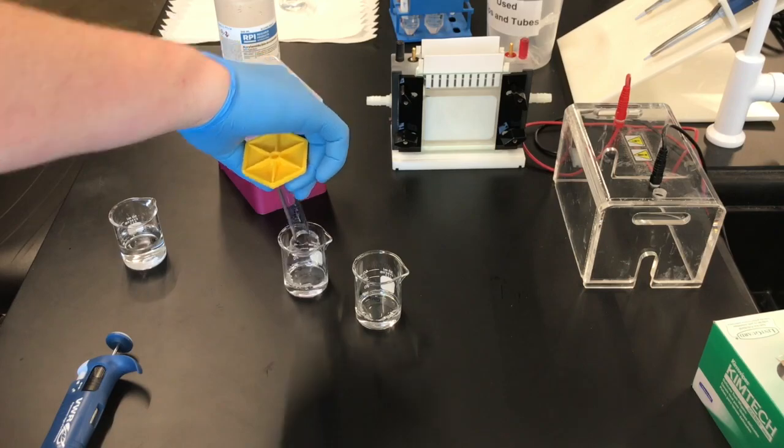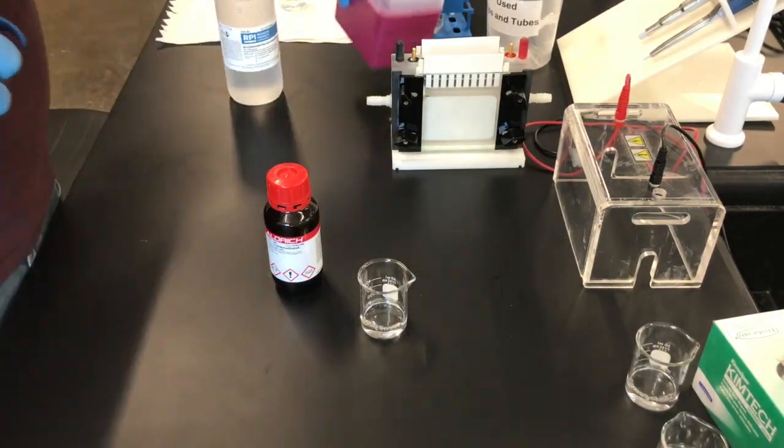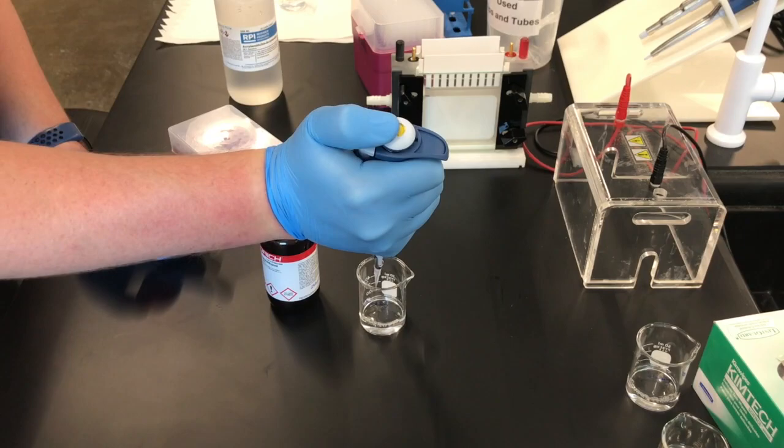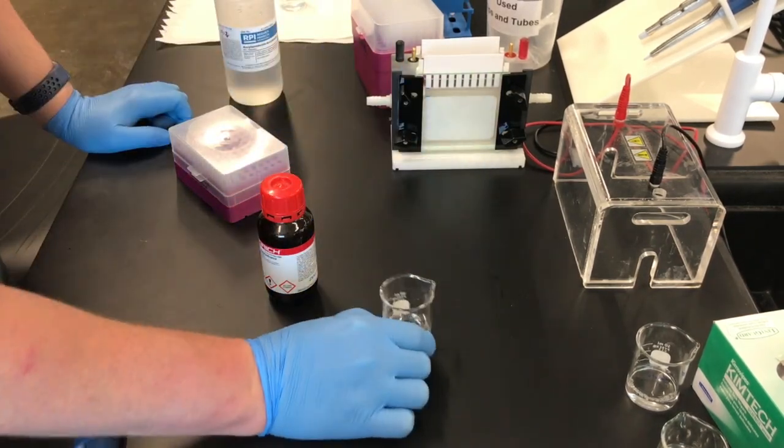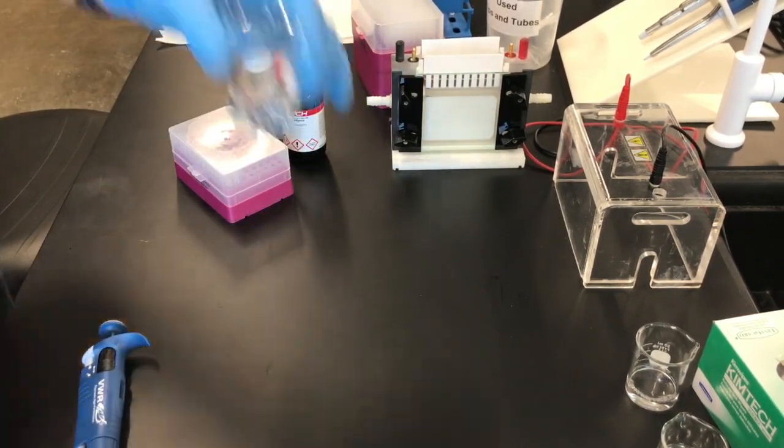Additionally, you can add the TCE carefully to the resolving gel. This is going to need a lot of mixing to actually get it to dissolve into the solution, but it will eventually go.